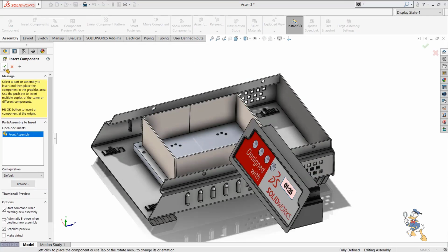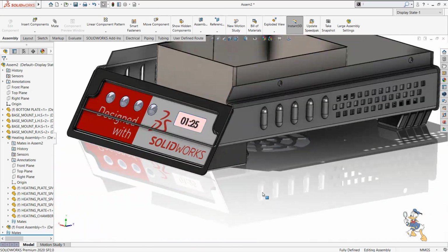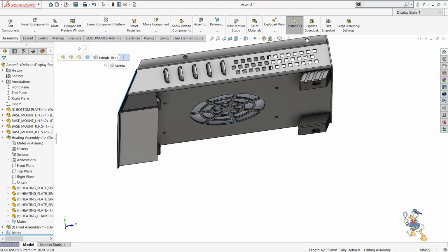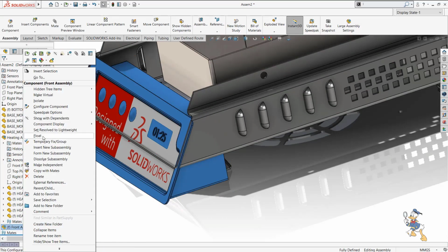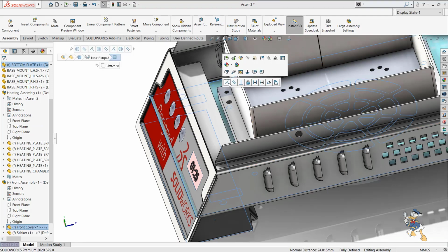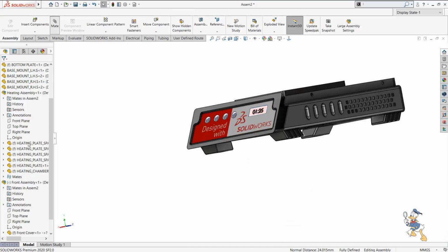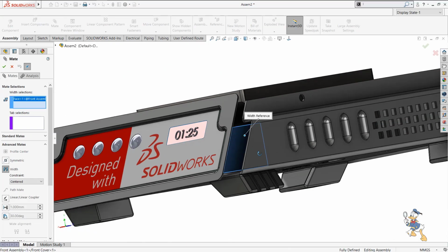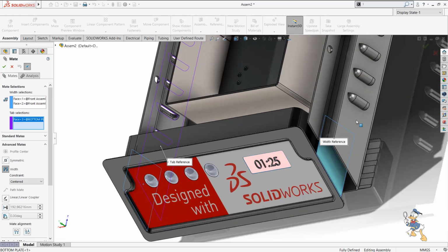I just need to select it and make it float. Is it at the original position? Yes, it is at the original position. No, it is not at the original position, so I just need to make it happen. So by making it float, I need to provide a coincident mate to this, and now I need to make some sort of width mate with respect to this face, this face, this face, and this face.